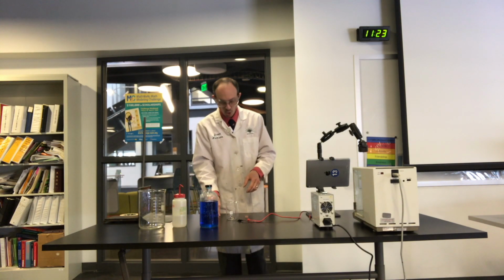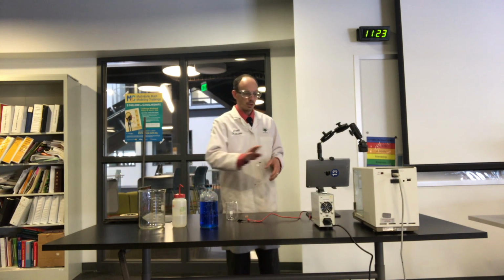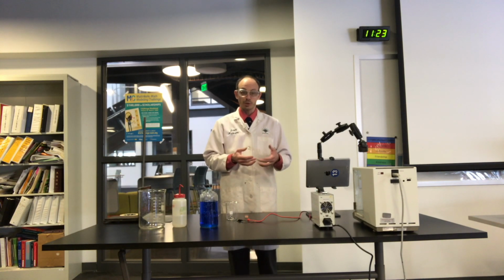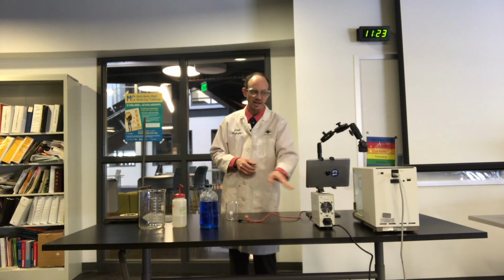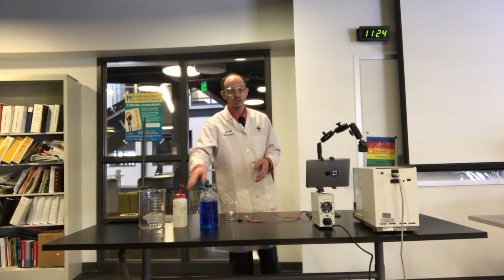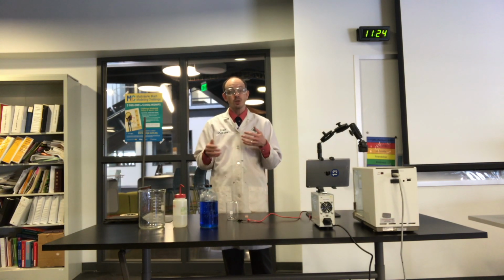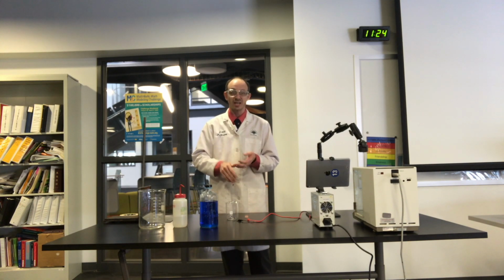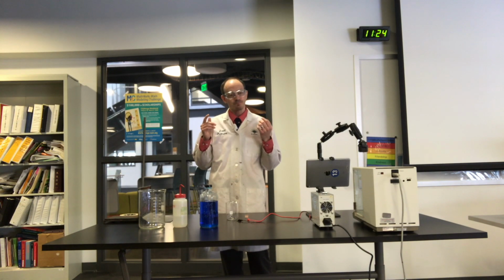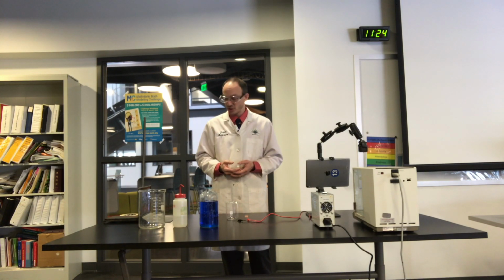So today, we just have a real simple setup. We have the same volt and amperage reader and giver that we had last time, the same box. We have our scale so that we can trace masses. I've got some acetone to do a quick rinse so that we can get rid of the water without scrubbing and rinsing it and then having to let it dry for an excessive amount of time. But other than that, that's pretty much it.